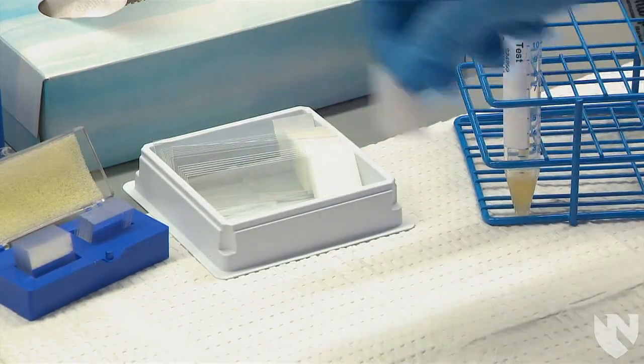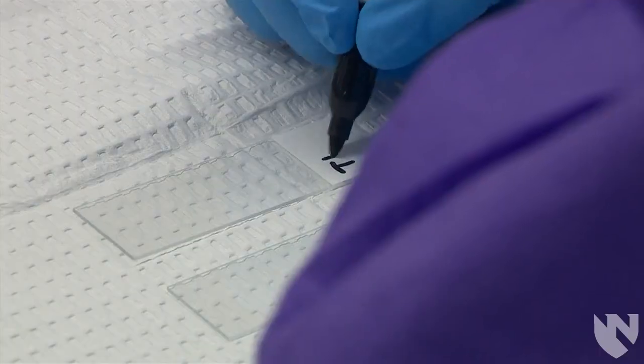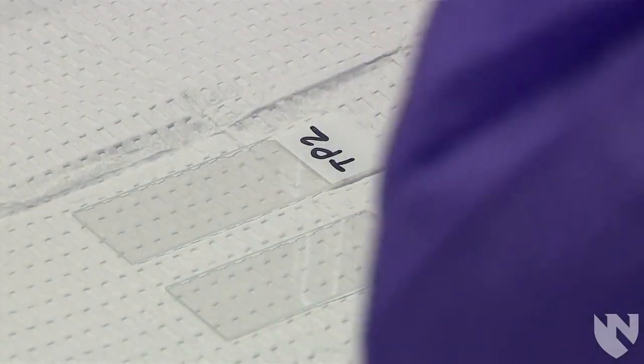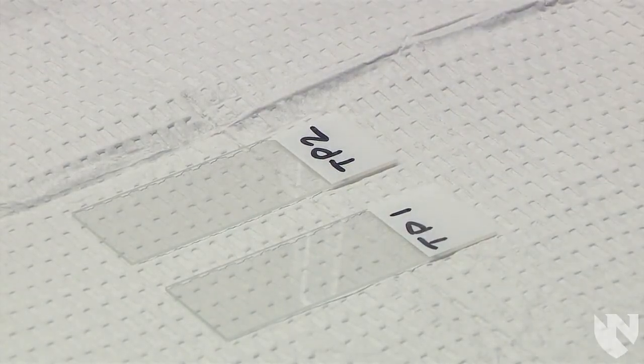Place your glass slide on the white mat on the bench. If you are going to be performing multiple microscopics, it might be a good idea to label your slide with the patient information.